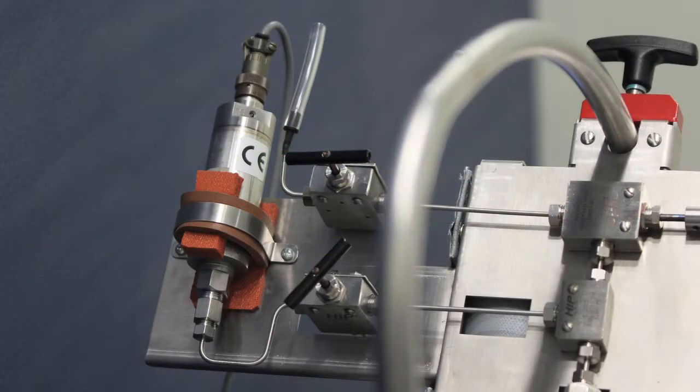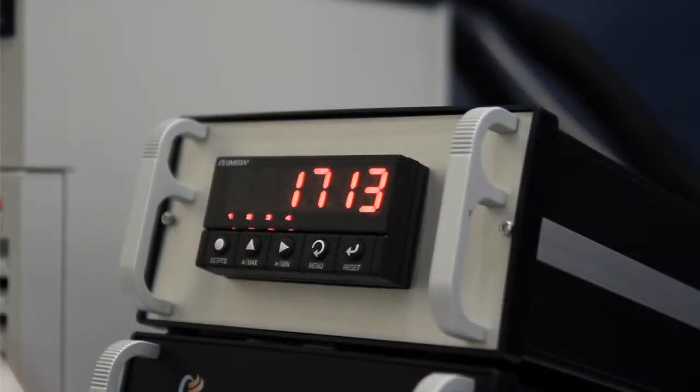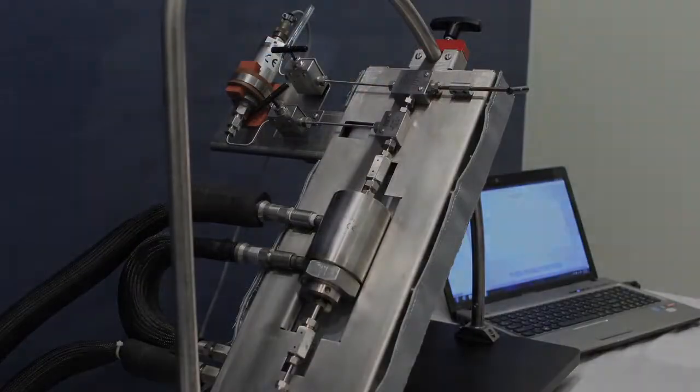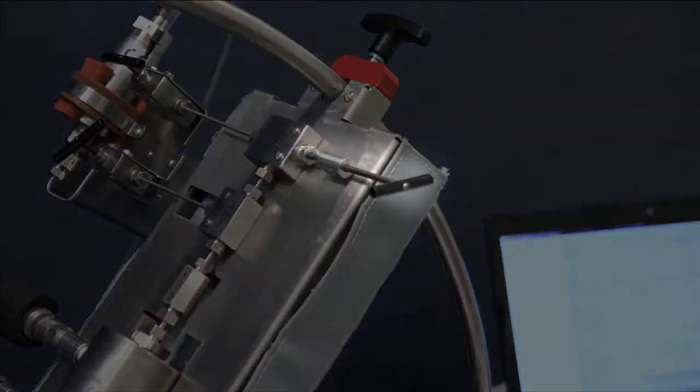The pressure transducer to measure pressure. Pressure display output reading. Sample inlet valve. Exhaust valve. Fine adjust valve.